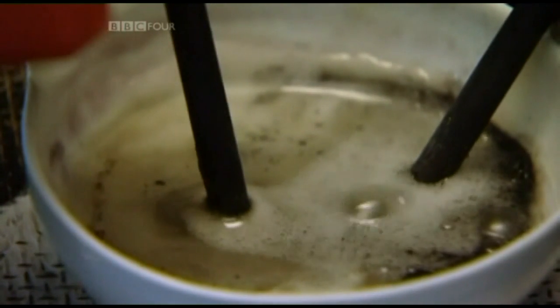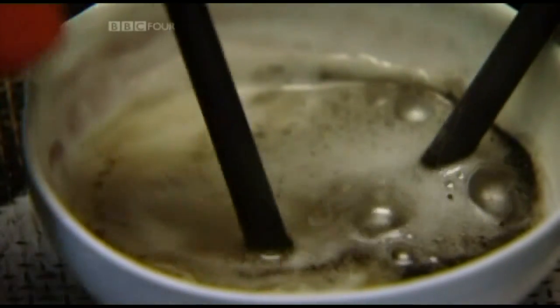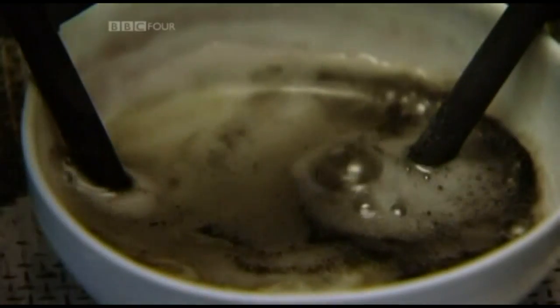Oh, look, there it is. Oh, is that pink flash? Yeah, the lilac flash. That's where the potassium is being produced and it's reacting straight away.